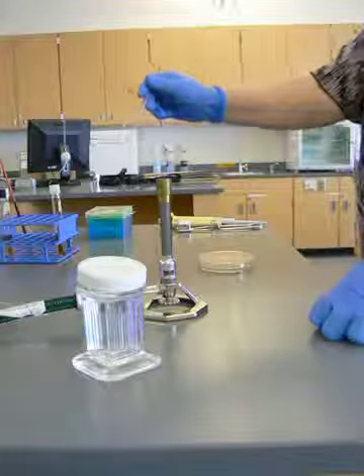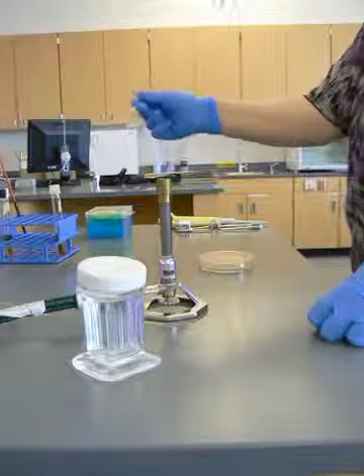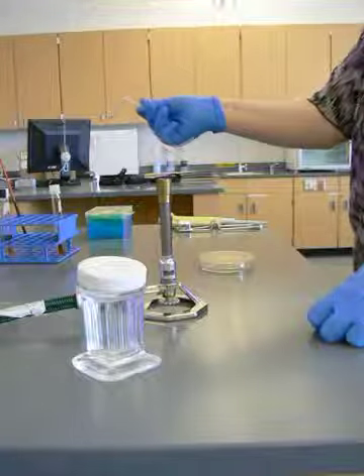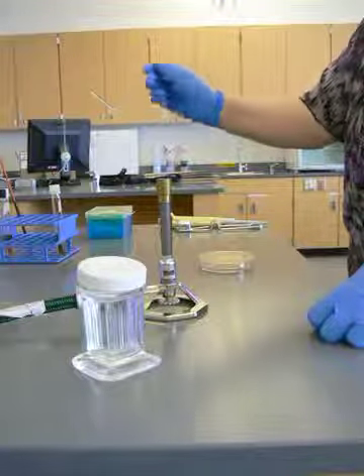You can see where the flame has been. Everything is all nice and sterilized. The flame has been on the entire bottom of the hockey stick.